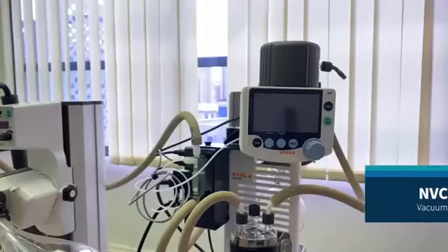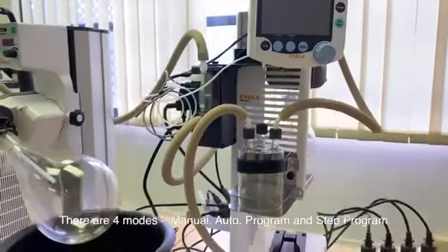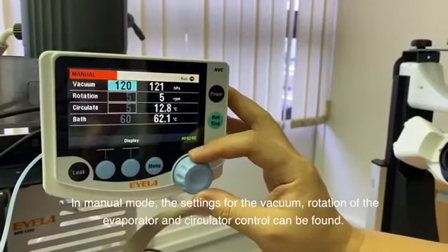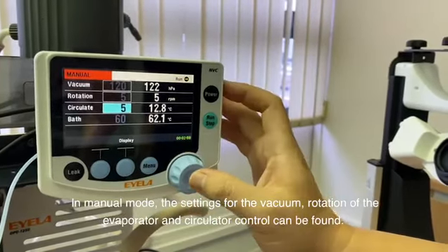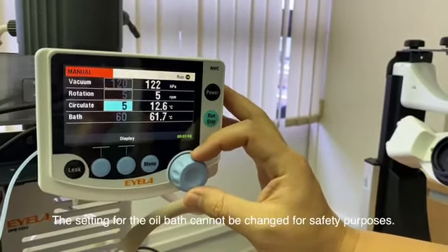This is the vacuum controller, NVC-3000. There are 4 modes: manual, auto, program, and step program. In manual mode, the settings for the vacuum, rotation of the evaporator, and circulator control can be found. The setting for the oil bath cannot be changed for safety purposes.